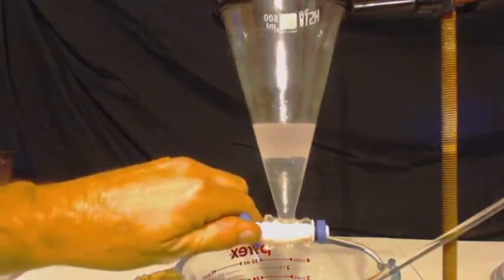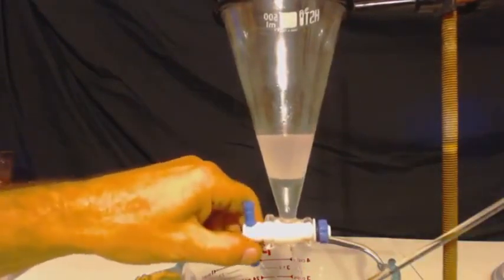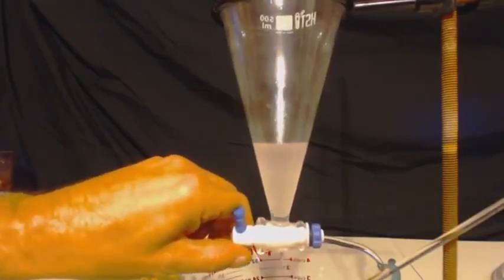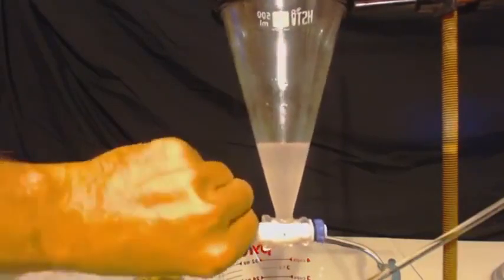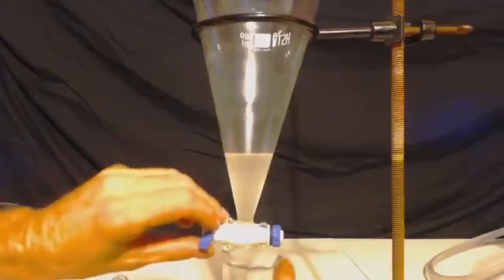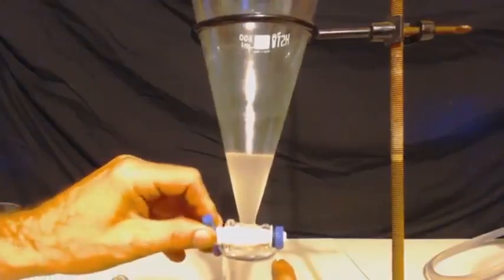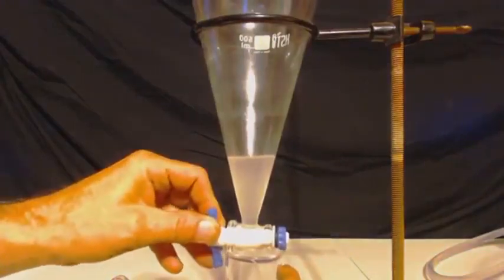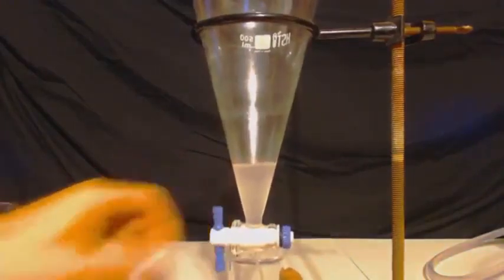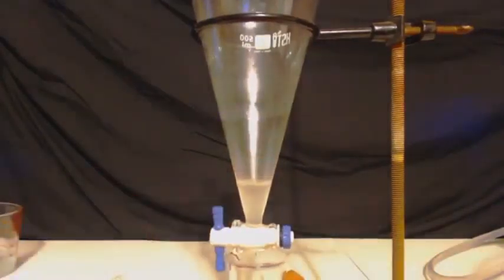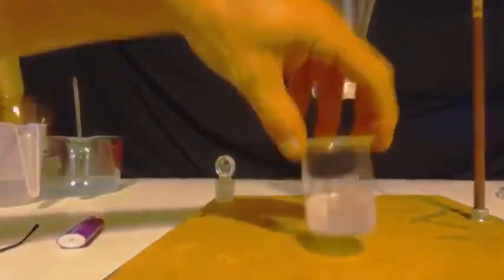Just like in the beginning, I want to get rid of some of that water. I was just washing my toluene with water, so there's traces of water, so I threw some salt water in there. That's the bottom layer you see me draining out right now. Now I should have pure toluene there, except with a little bit of water in it, traces of water. So I'll drain it out, see how much it is. And I will add some anhydrous magnesium sulfate to dry it out.